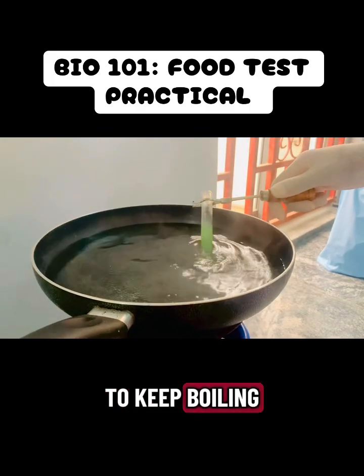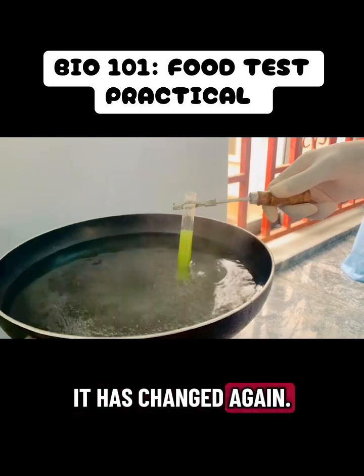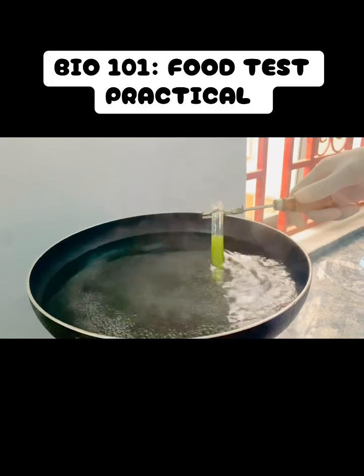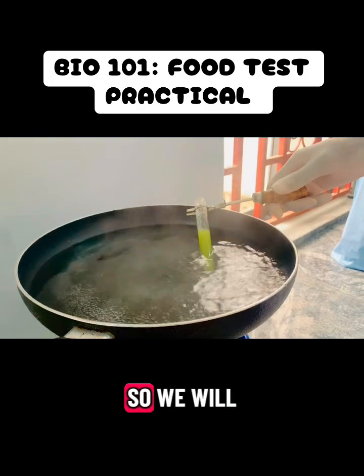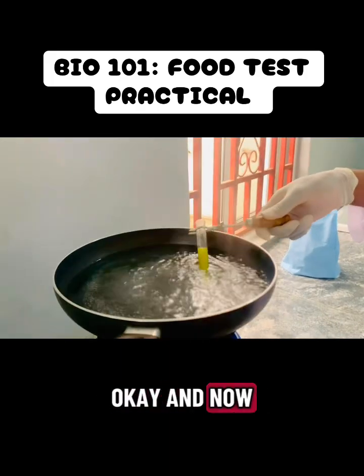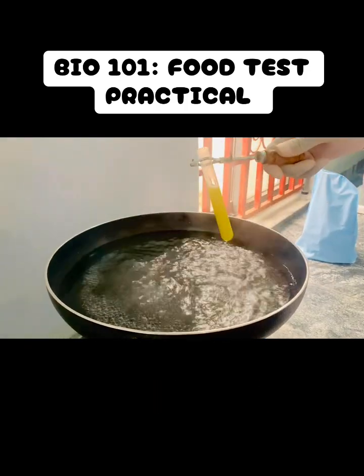So we have to keep boiling, and you see the color keeps changing. You see now it has changed again. Now I think this is lemon green. I'm not very good with colors, so this is it. We keep boiling, expecting a particular color change, so we will not stop until we get there. You can see it's moving again. Okay, and now I think this is yellow, if I'm not mistaken.